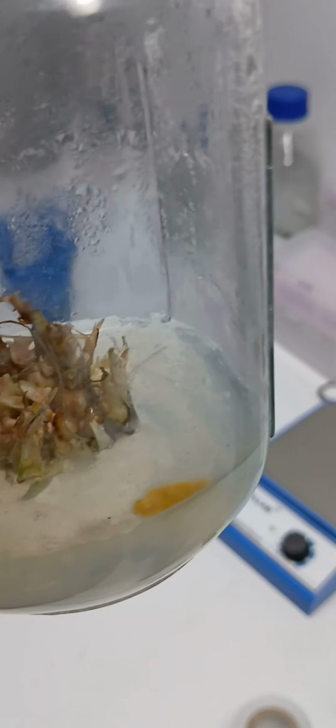As you'll notice, the plant material itself is completely contaminant free. It is isolated to these two little areas on the outside of the container. That indicates to me that when the container was turned on its side, something dropped in, and there again, dropped at the bottom of the container as I turned it. And I would say it was something off of my skin.